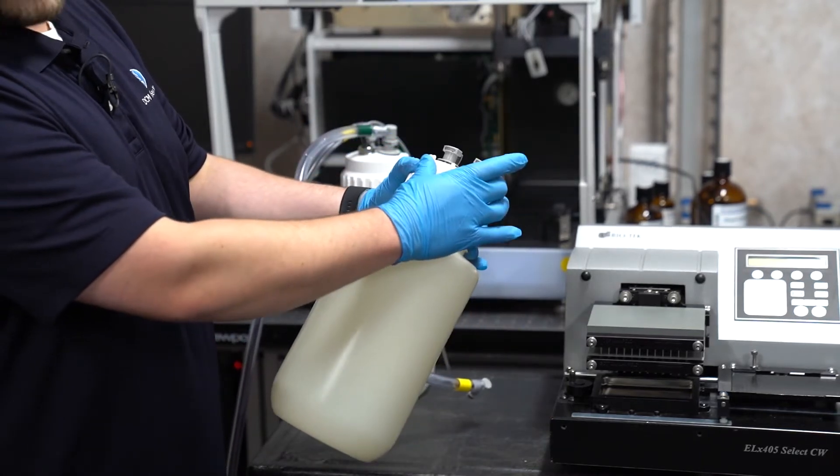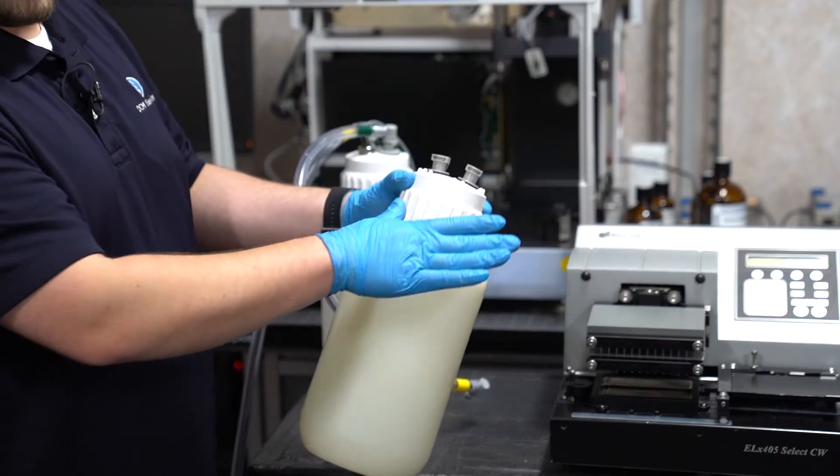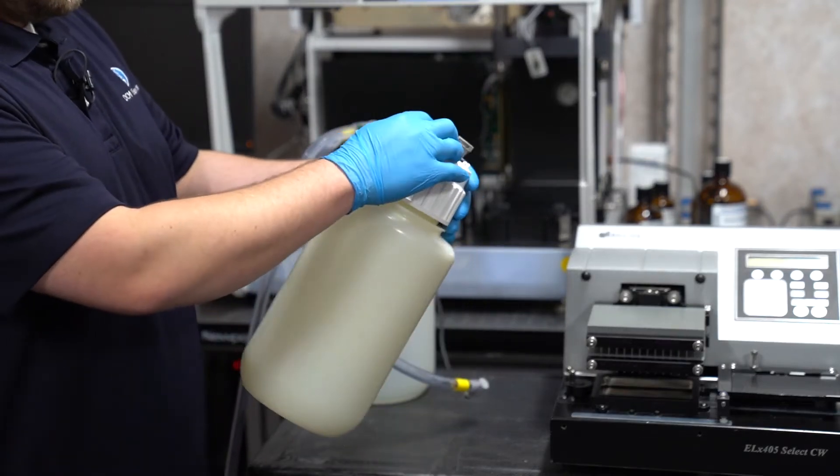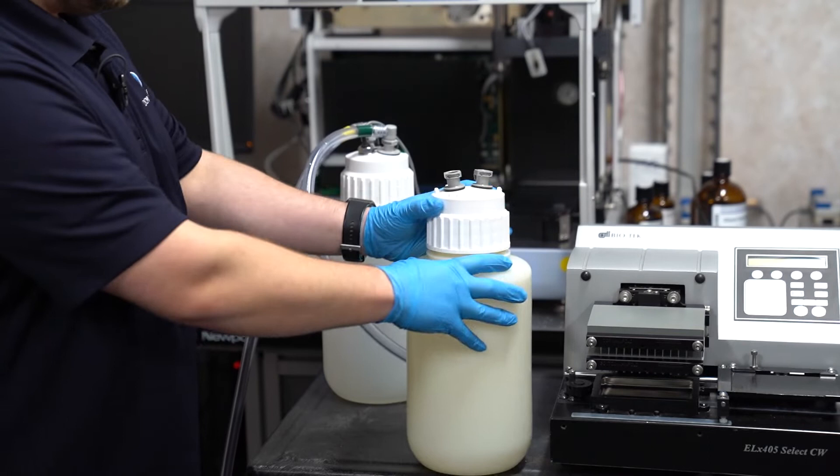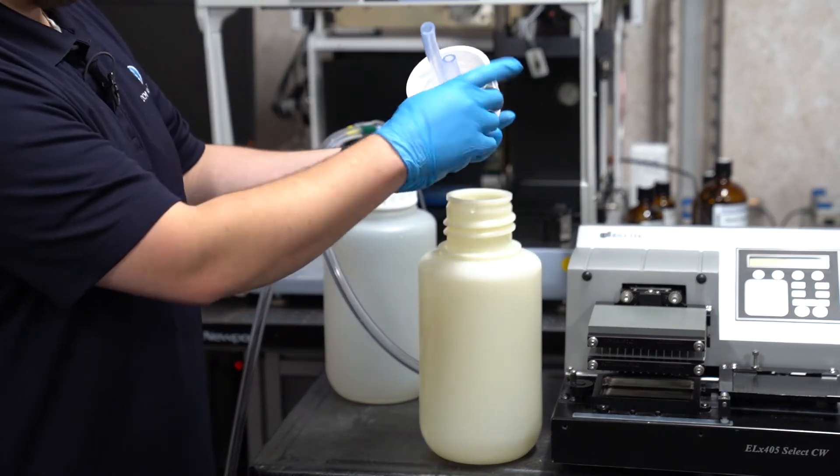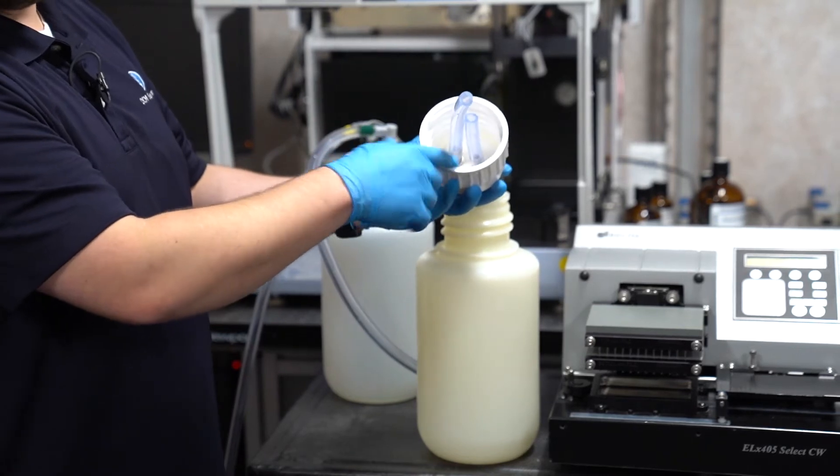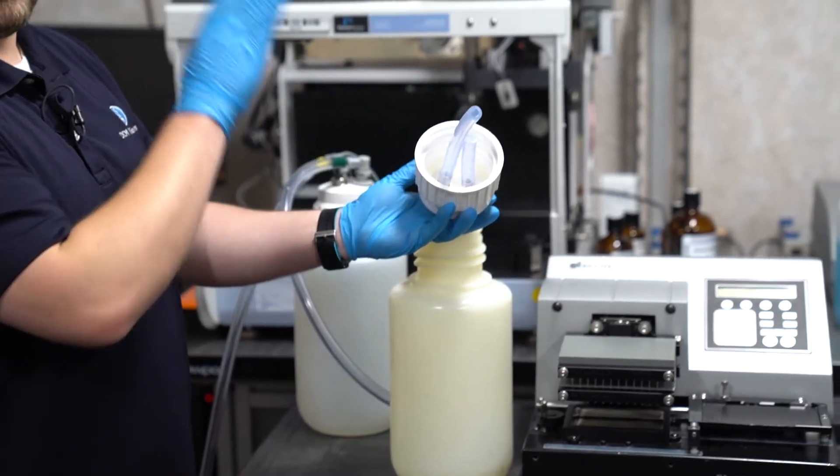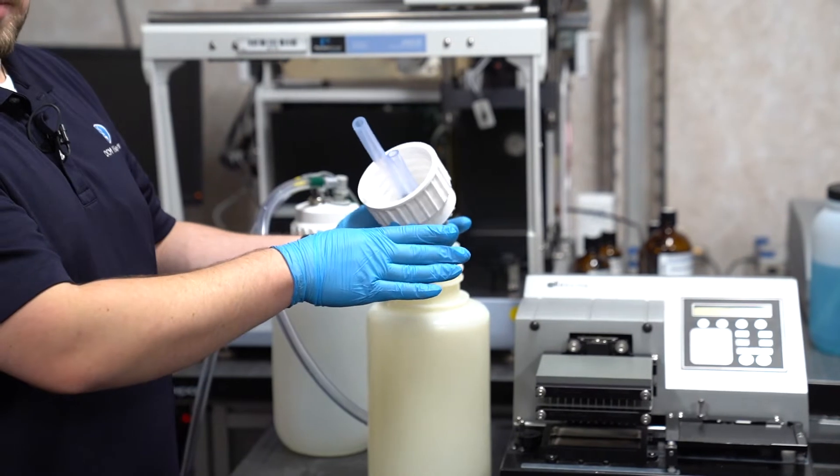The gaskets on the top need to be inspected. Make sure they're not cracked, damaged, or otherwise faulty. Open the cap up. We want to ensure that the cap o-ring is in position, and just like the other o-rings, in good condition, doesn't appear to be faulty.